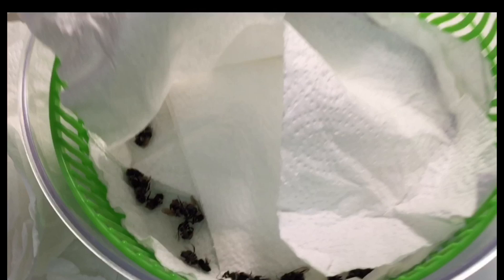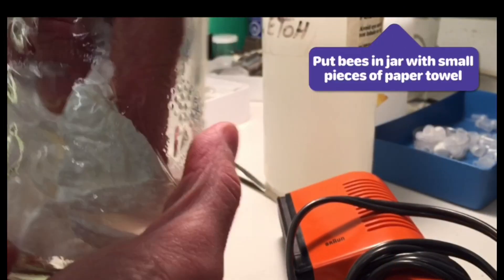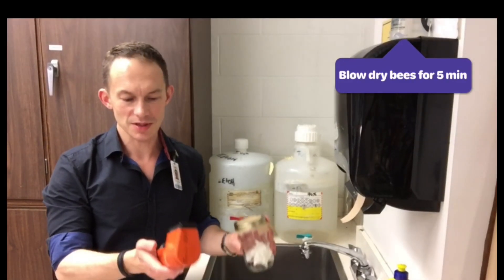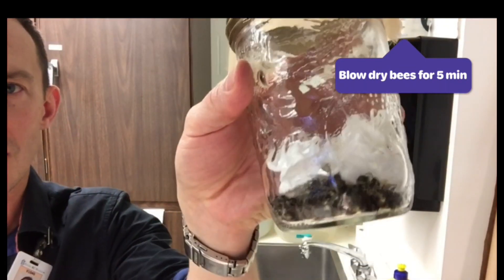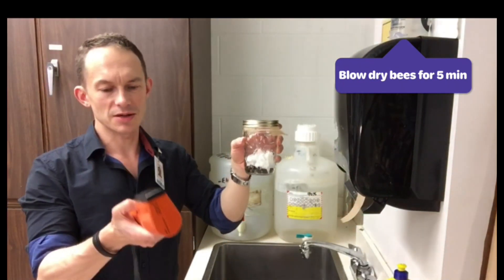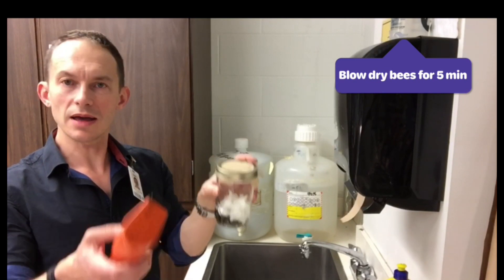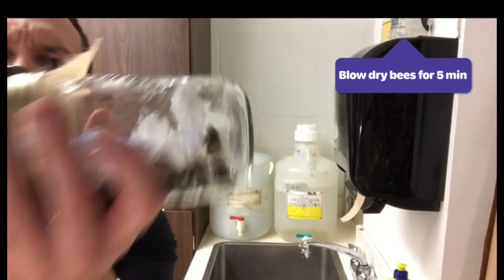Let's take a look and see what the bees look like. The bees are quite a lot drier now — they almost look fluffy, some of them. So we're halfway there. Make sure the jar is dry first. We gave the bees a shampoo; now we're going to give the bees a blow dry. You want to blow dry them for about five minutes. So the bees are in the jar here with some paper towel. I've just got a regular hair dryer — I've brought the mesh on top, I'm going to turn it on high, invert it, and just dry the bees like this for five minutes.